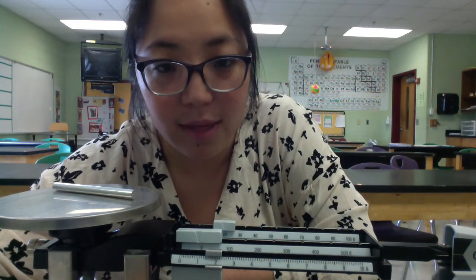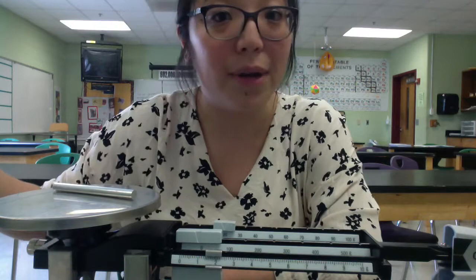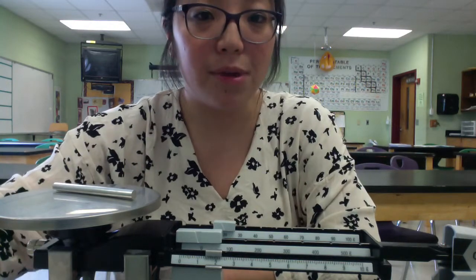So again, we need to know how to use a triple beam balance. So we have nothing in the hundredth spot. Here is the 10 spot. Then this is the center. That is the center of the weight. So you should be able to figure out approximately what the mass is. I am hoping that you can see my cursor. I don't know. So now you are going to use the formula.